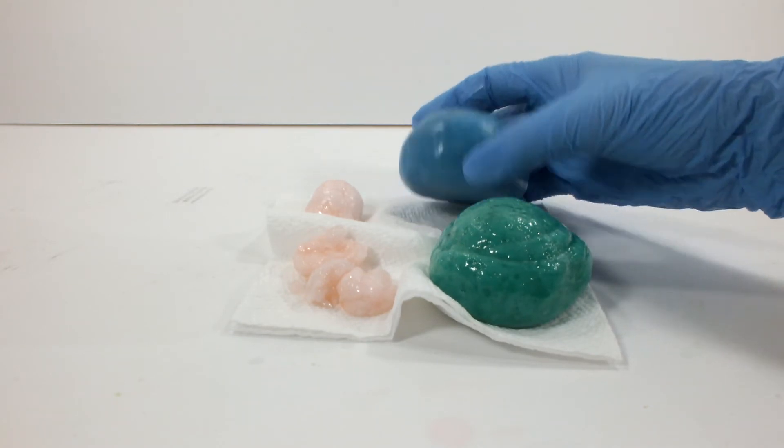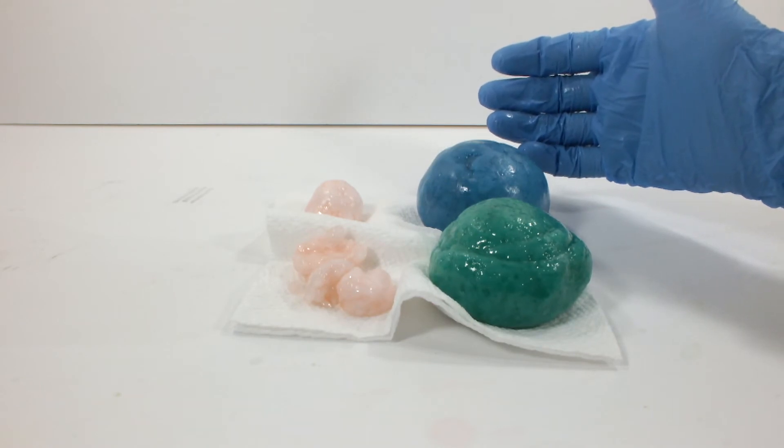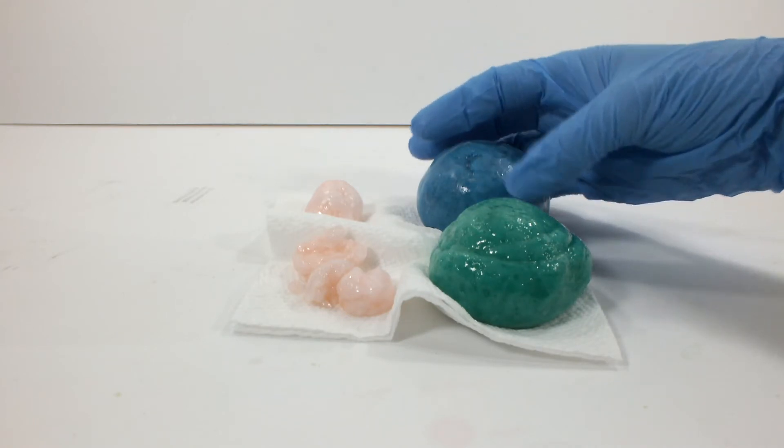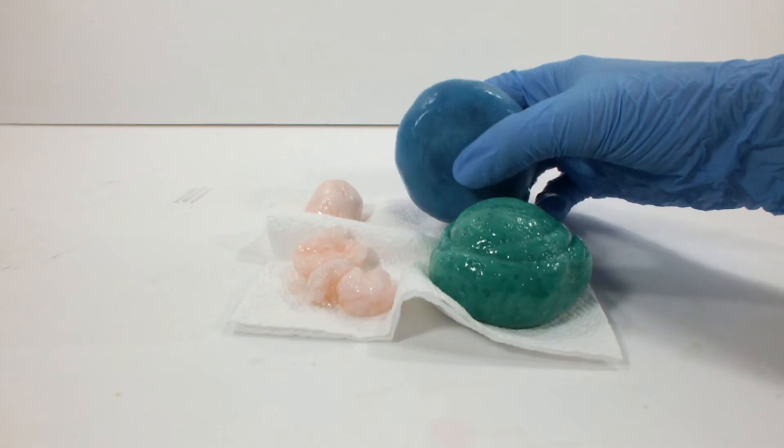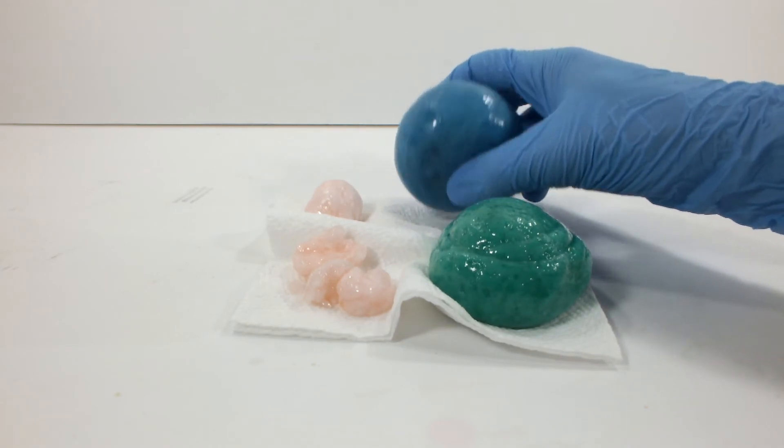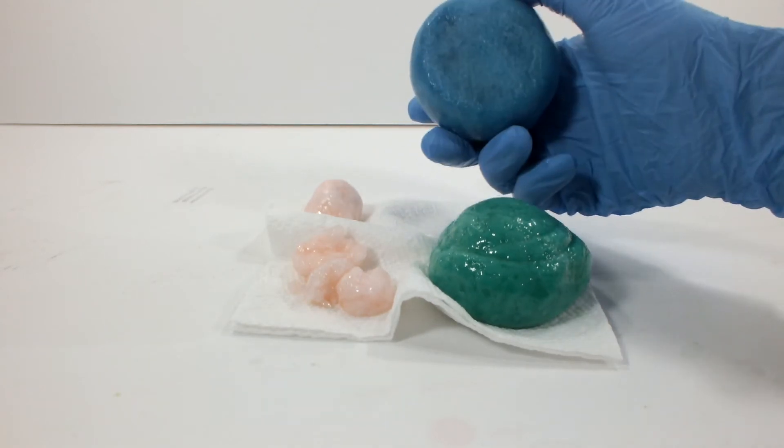So it's a fun little experiment. A little messy. A little bit, well, for me it was a lot messier than it should have been. But it's still a little bit messy even if it's contained in the bag. This actually, when I made this one, it burst through the side of the bag.